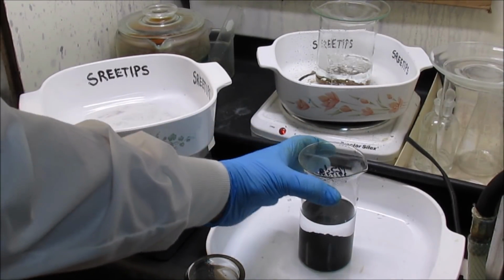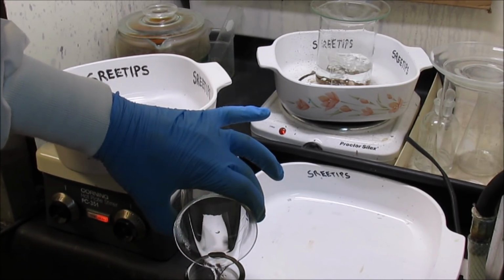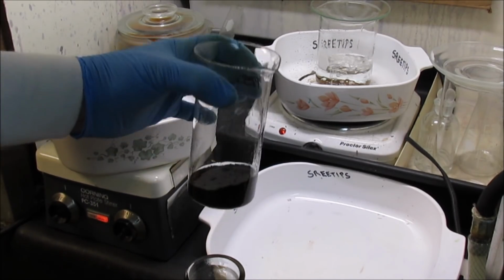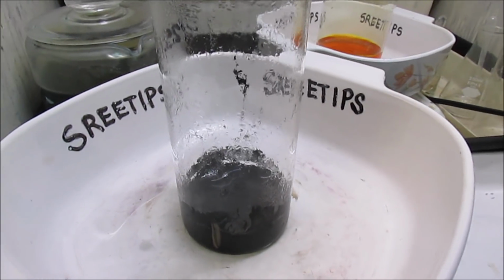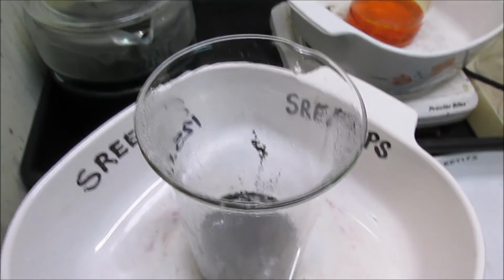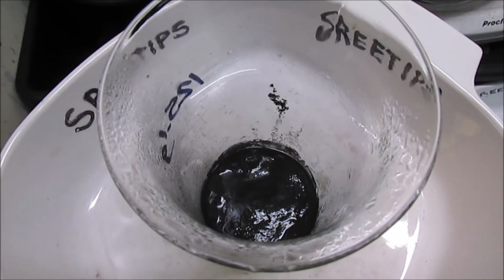Okay, I've got it all rinsed out. It took 20 rinses. Now what I'm going to do is pour off this final rinse here, and then we'll put the beaker up on some low heat and evaporate the powder to dryness so that we can get a weight on it. Alright, I've had this on here about half an hour now, and the moisture is being evaporated out of it. This is something that can't be hurried, otherwise you'll start spattering the platinum group metals out of the beaker. So I've got to heat it slowly until I get it bone dry, and then we'll get a weight on this powder.